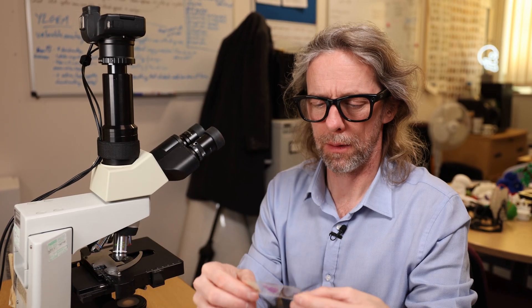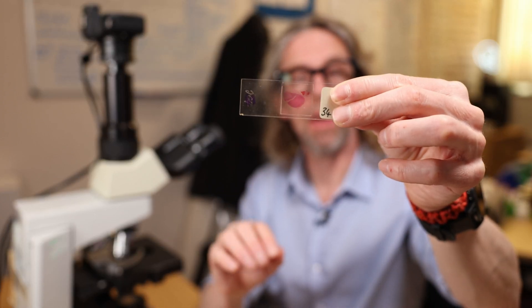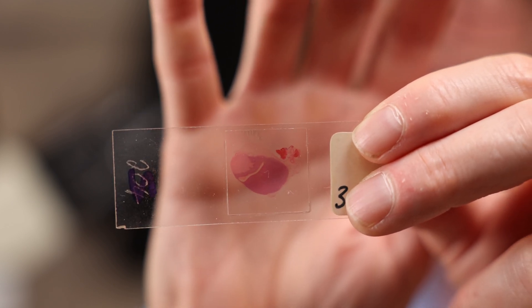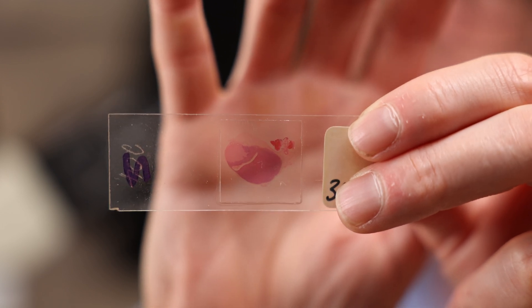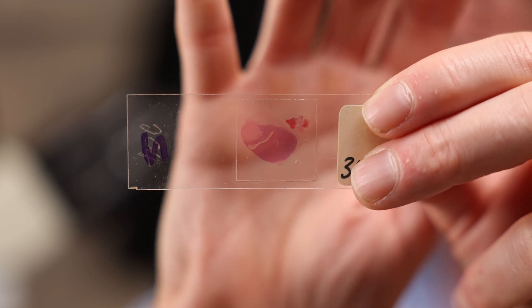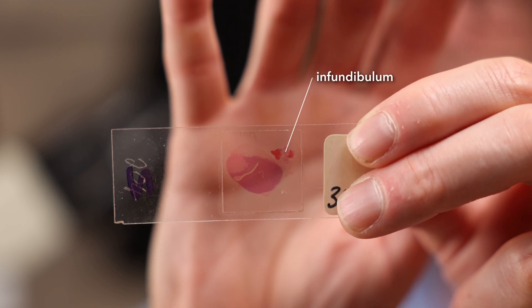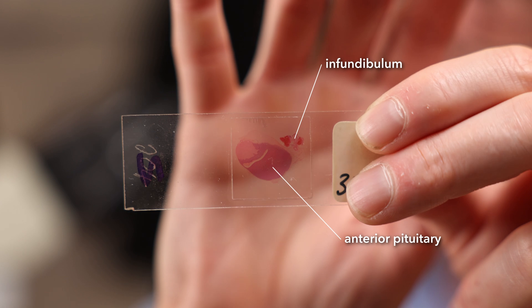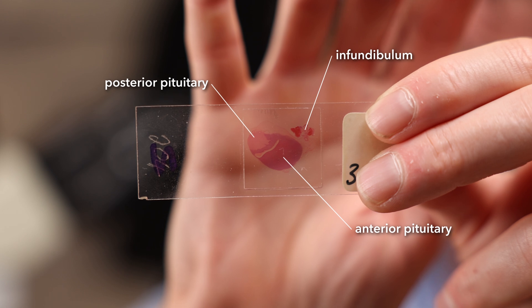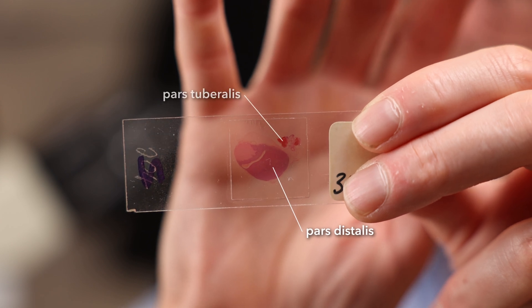Looking at the whole pituitary, we can see a little wedge in the middle with a gap, and a stalk which connected it to the brain — to the hypothalamus. We can see something wrapping around the stalk, a lightly stained part and a darkly stained part. The stalk is the infundibulum. The anterior pituitary is the dark-staining, larger part, and the posterior pituitary is the lighter-staining part. The anterior pituitary has the pars distalis, which is most of it, and the pars tuberalis, which wraps around the stalk.